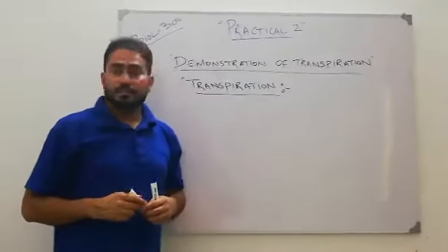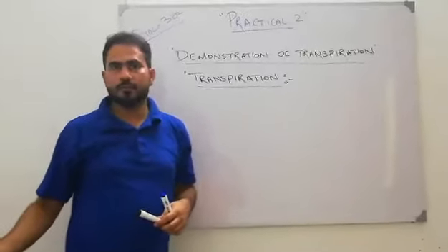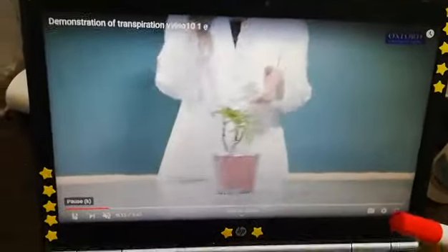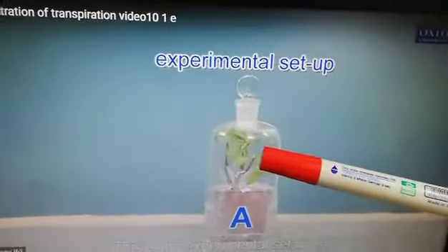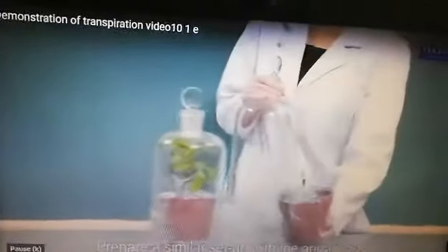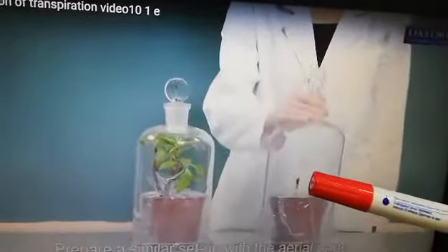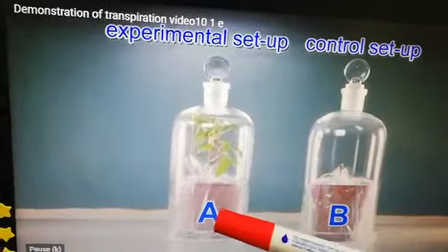We will see the demonstration of this practical through this video tutorial. As this is an experiment, we have a pot with a plant. You are seeing this experimental setup here. We also have a second pot where the aerial parts of that plant have been removed. So we have two jars — Jar A, which is the experimental material, and this is the control.